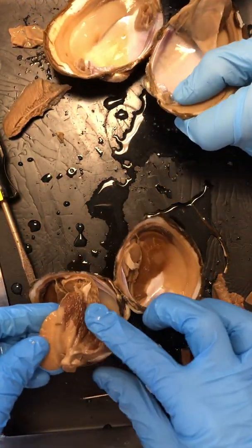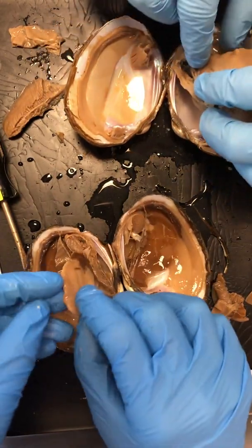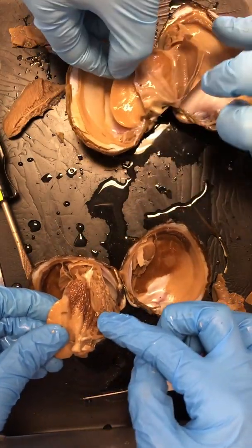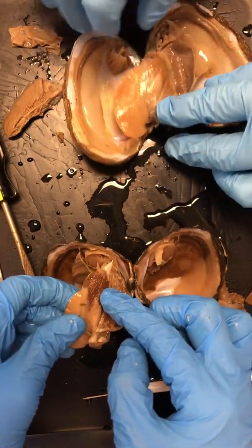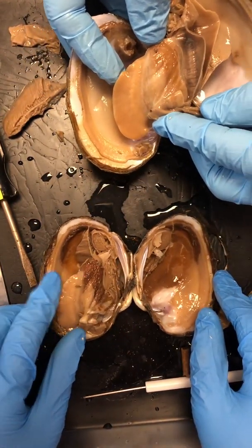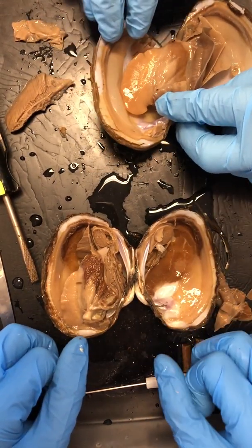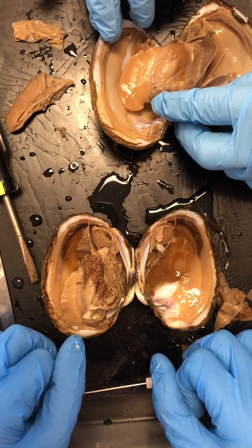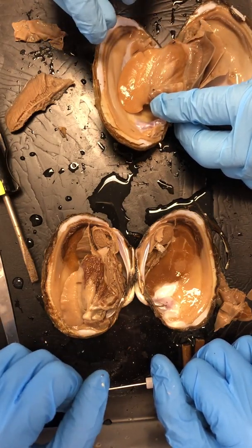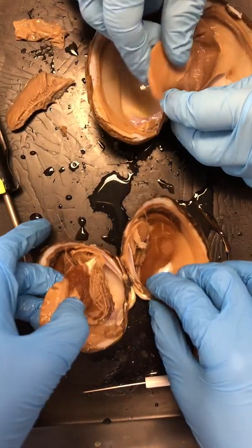This guy must have had some hard times because look at this weird discoloration in his foot. Right here, the foot looks nice and healthy. It's nice and hard. And then here, you've got this weird, almost crystallized feeling. Yeah, squishy. This one also has some discoloration. True, but I wonder if it's an age thing. Yeah, maybe your mussel is younger, but it's bigger. Mysteries. Well, maybe something in the preservation process too. That would be, I think, an important feature to keep in mind.